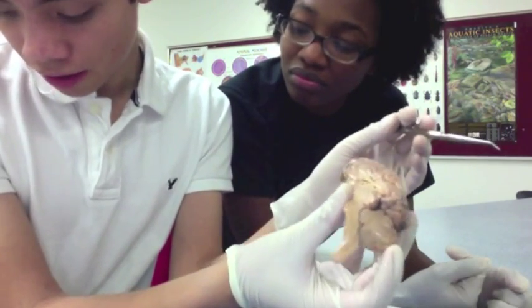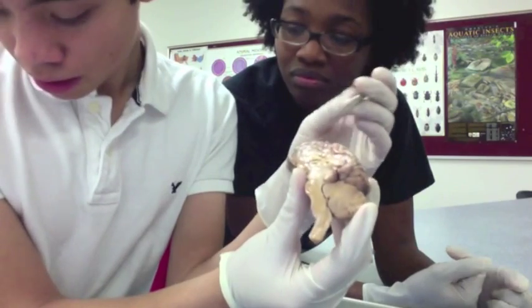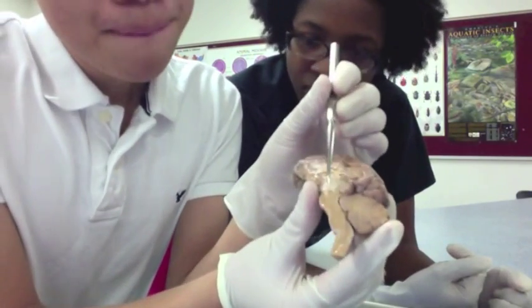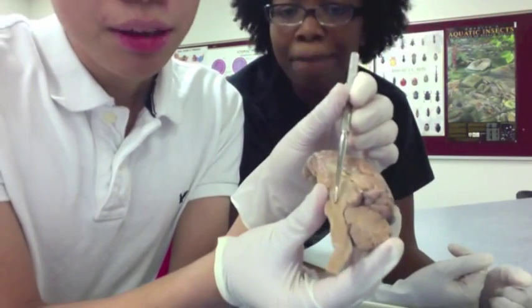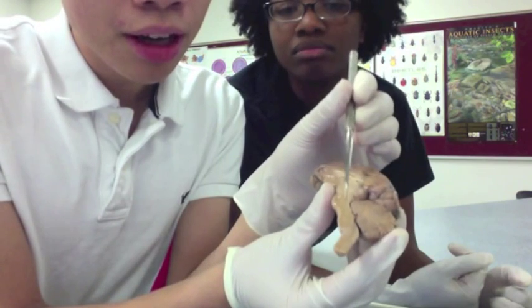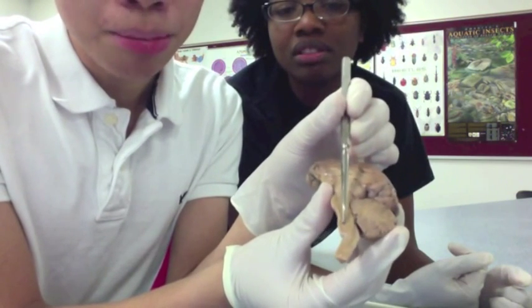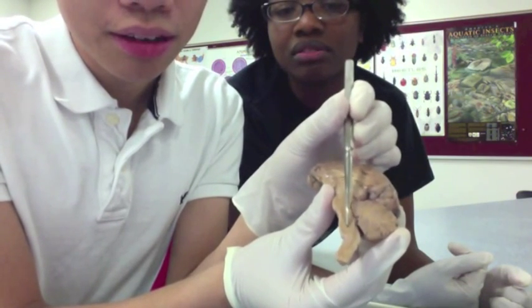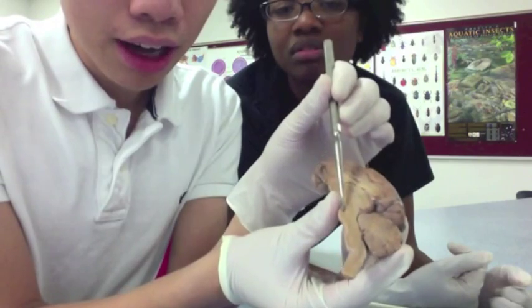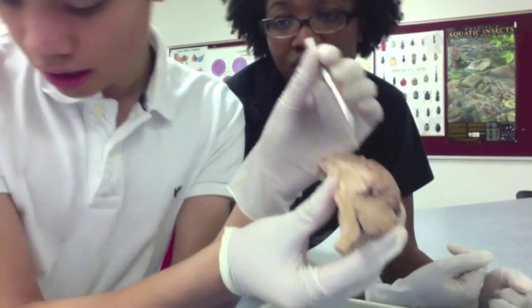You have your pons — that's this little bump right here. Medulla oblongata is the second bump below that. So, medulla oblongata, then you have the pons.